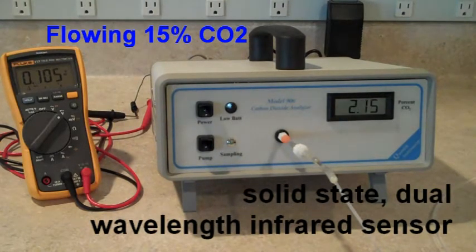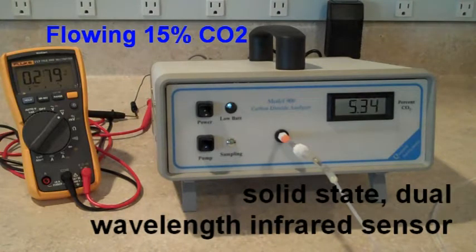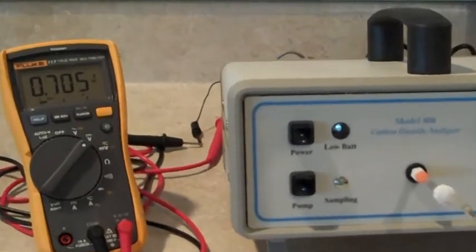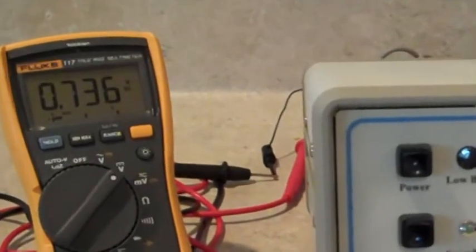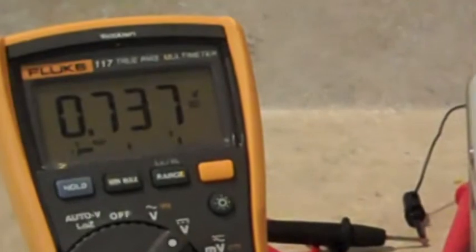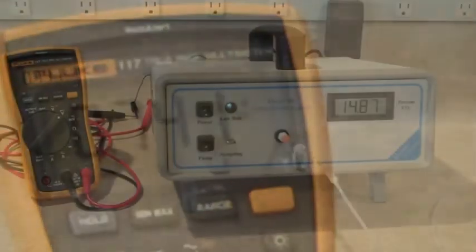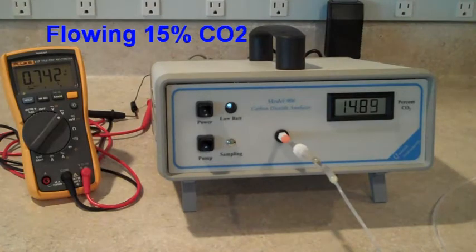Now we're flowing 15% CO2 through the analyzer. And on the left, you'll see the Fluke voltmeter approach 750 millivolts, which is about 75% of the 0 to 1 VDC range that we referred to earlier.